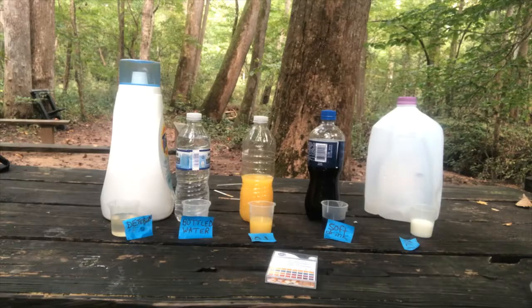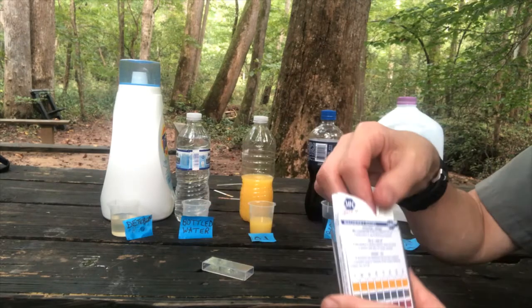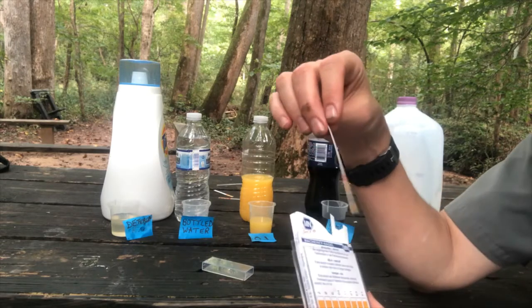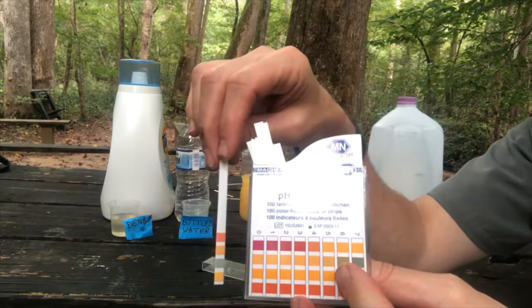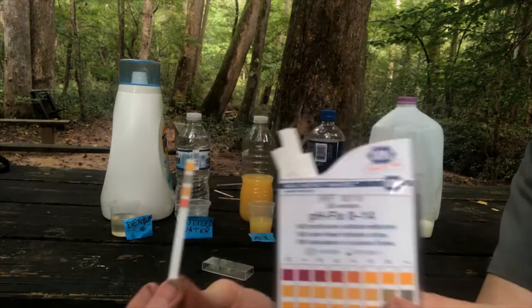So we can use what we know already, and we can ask questions, we can make statements and determine if they are true. And in this case, we're going to do that by measuring the pH next. And the next step will be to actually find out using pH strips. And so the chart we're going to use is actually on the box, and we're going to try to, turning it the correct way, determine the pH of each of these liquids.